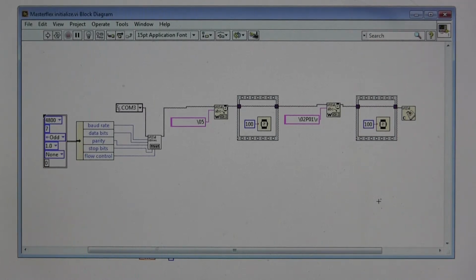Here I'll describe the LabVIEW programming behind the operation of our Masterflex pump. The first program that I'll discuss with you, what we're going to do are two programs, and the first one is the initialize. We call it Masterflex initialize.